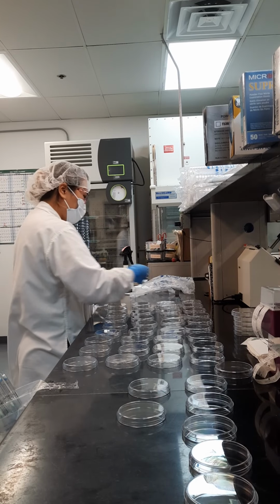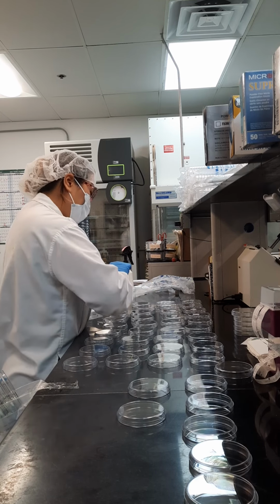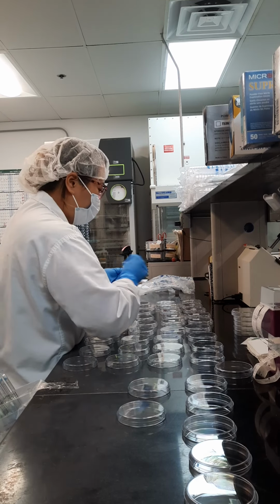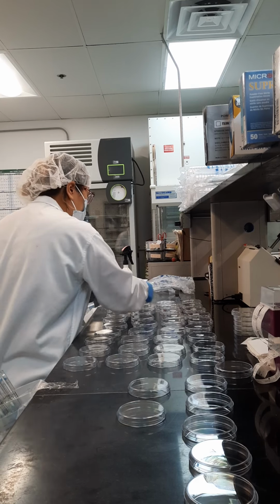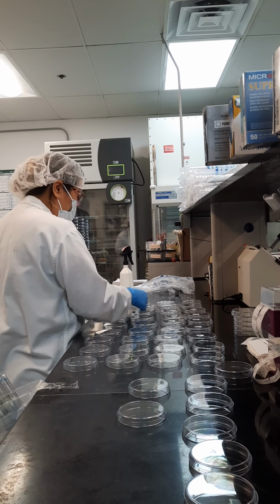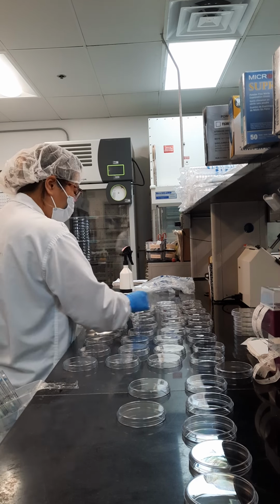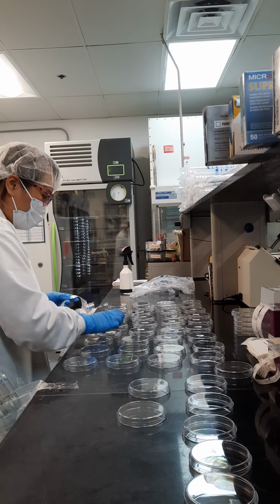I stick it out. These stickers just have the ID on them. Sample IDs and what tests are being done. Some companies require 2 testings done just to verify that the testing is done correctly, which I think is smart. It just adds extra work for the technicians.